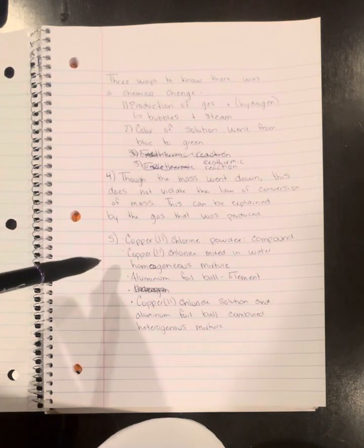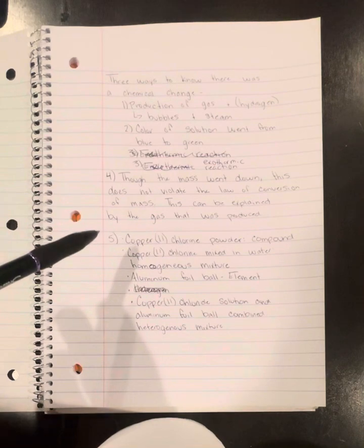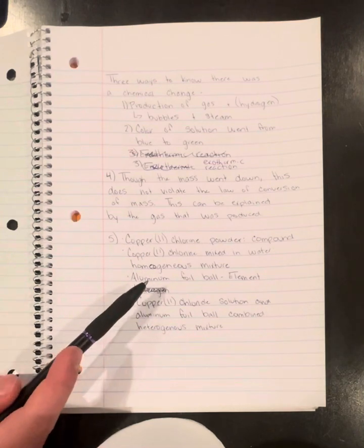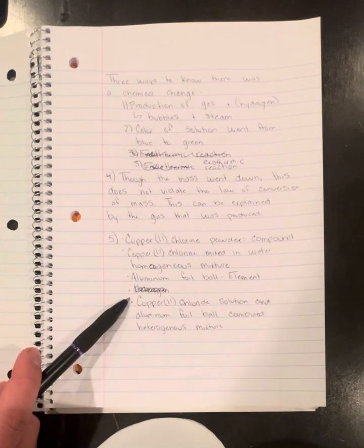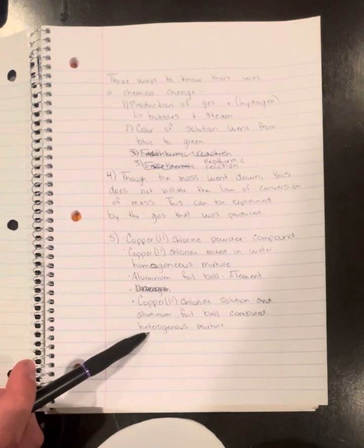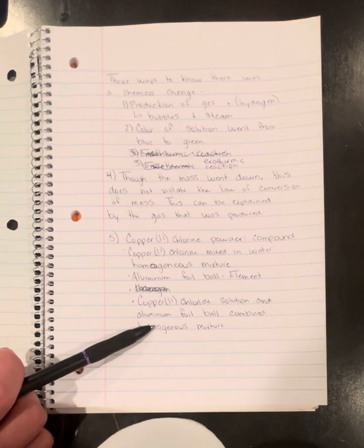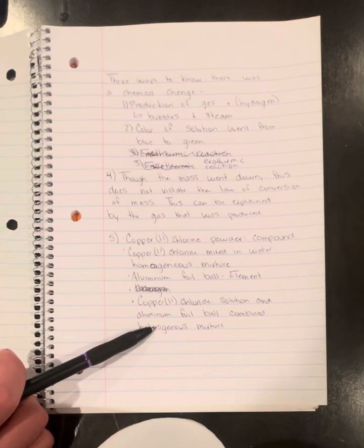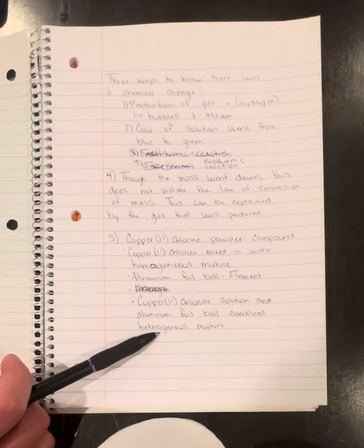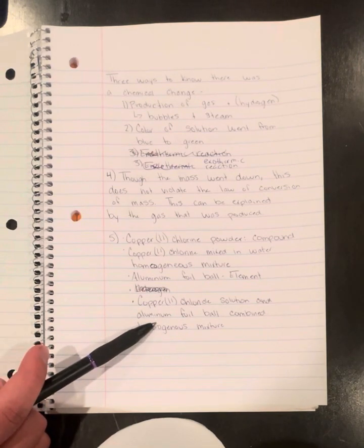And then the aluminum foil is an element. It is a metal. It consists of a single type of atom, and the foil has many qualities of metal. Lastly, we'll be looking at the copper chloride solution and aluminum foil ball combined, that's a heterogeneous mixture. When copper chloride solution is combined with an aluminum foil ball, the result is a heterogeneous mixture. The aluminum foil does not dissolve completely in the solution, leading to the presence of distinct phases, the solid aluminum foil and the liquid copper chloride solution.